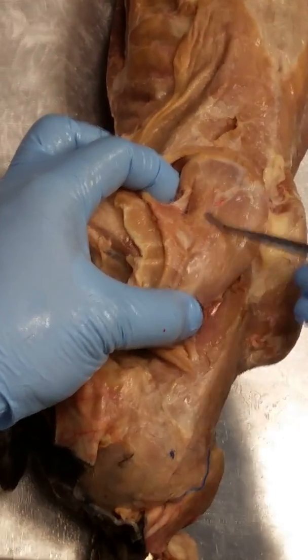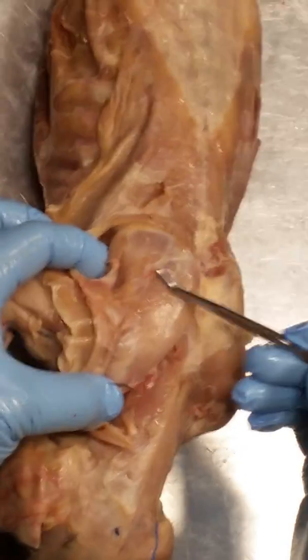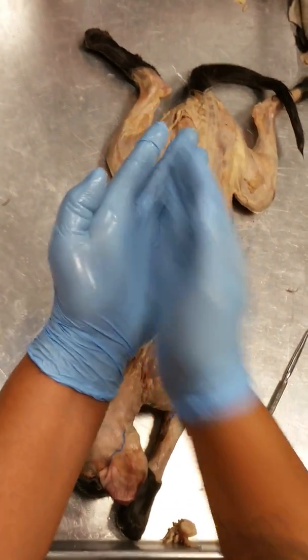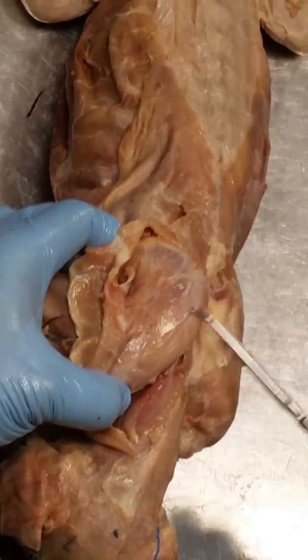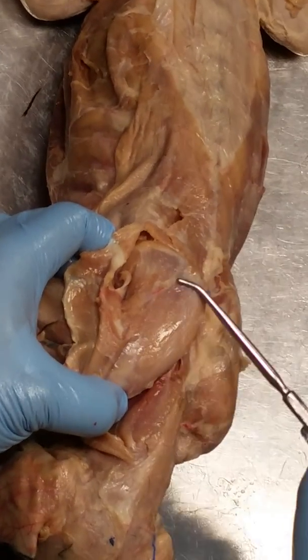Yeah. So look at, here's the spine of the scapula. And if we looked at the scapula bone, we noticed that it has this little sticky uppy thing. That's the spine of the scapula. So you know when you feel your shoulder blade, that's what that is. Okay? There's a group of muscles on top of or above the spine of the scapula.